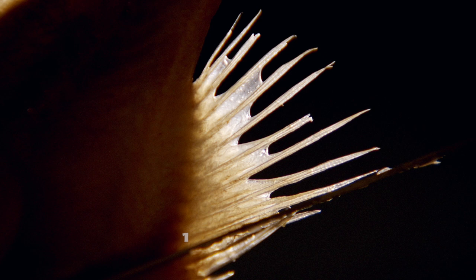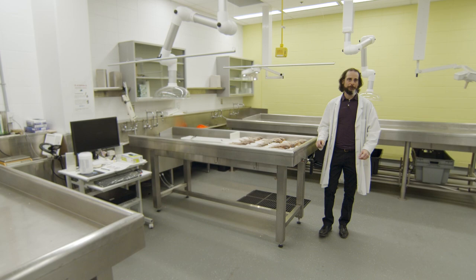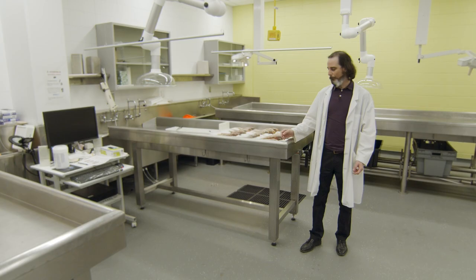Some counting errors are caused by the misidentification of the first ray. So be careful: you only isolate the first three spines and you start your count right after. Other errors are caused on the last ray when it's a bifid ray and it's counted as two different rays when it actually has only one insertion.